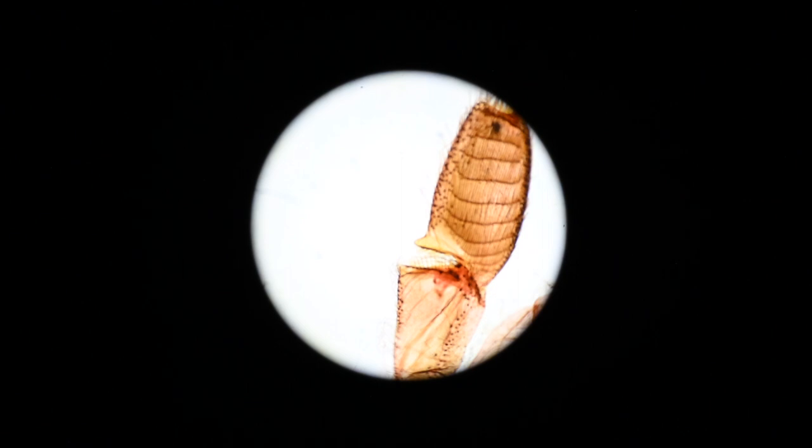So we have an image. The first obvious thing is that we have a circular field of view, and this gives the impression that you get a full field of view. However, what I seem to be missing is about the outer quarter of the field of view that I see through the eyepieces, so I'm not getting a full field of view.